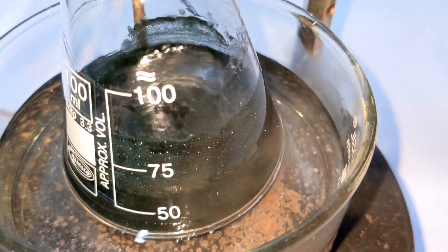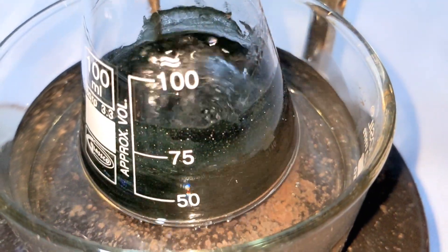In this closer shot, you can clearly see the dark green crystals formed.